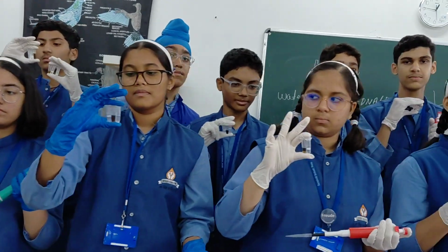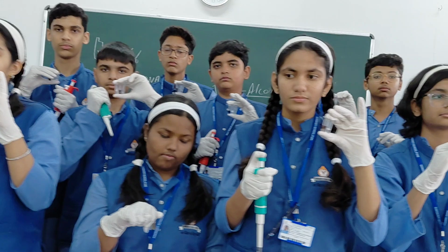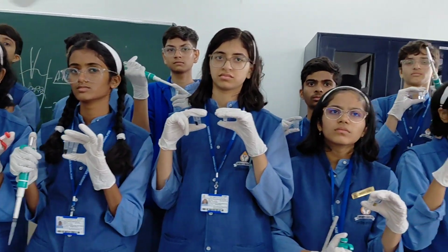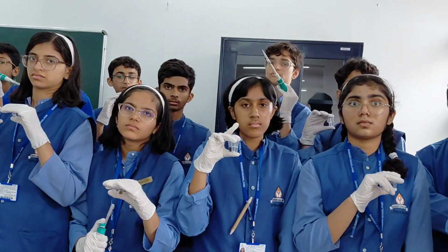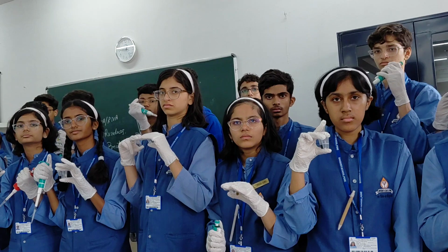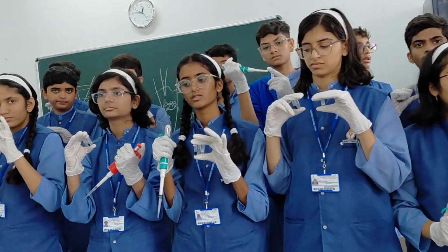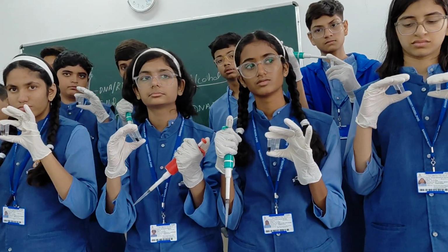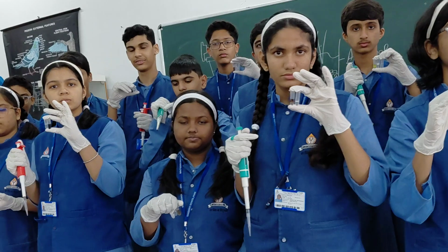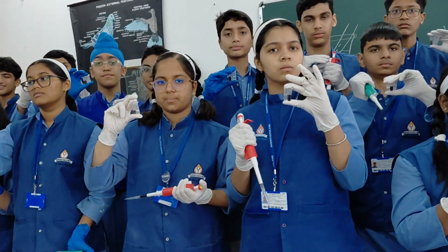The protein precipitation solution contains phenol, chloroform, isoamyl alcohol. Phenol has too much smell, so we generally avoid using it in a regular lab, right? So only chloroform isoamyl alcohol is utilized for protein precipitation. After that you will use 100% alcohol. That's called the DNA precipitation solution.